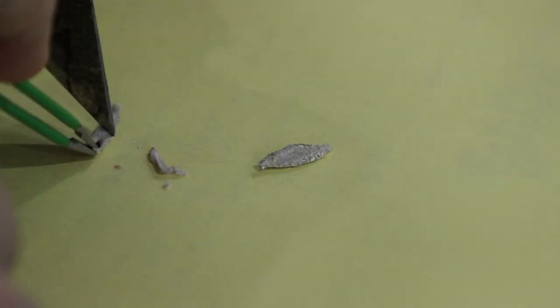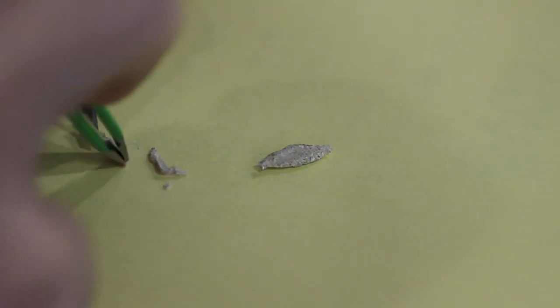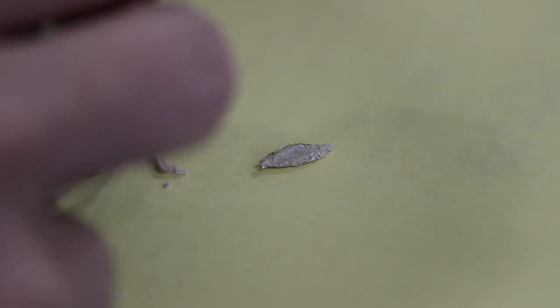But let's see if we can... Yeah, it looks like... Is there anything there? No, I really don't. Oh, whoa, no. What is that? Oh, it's the larva.